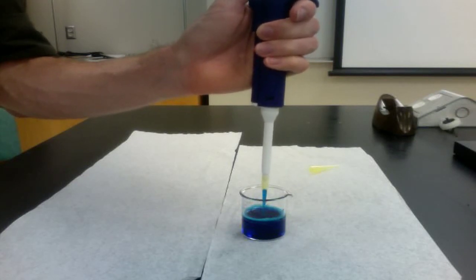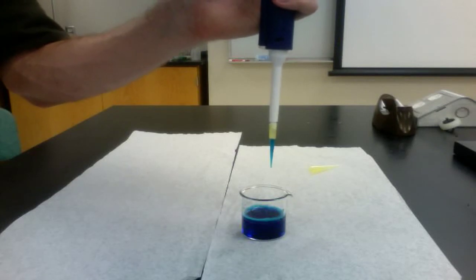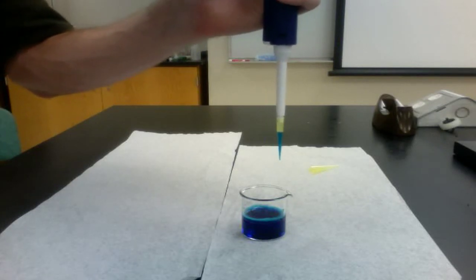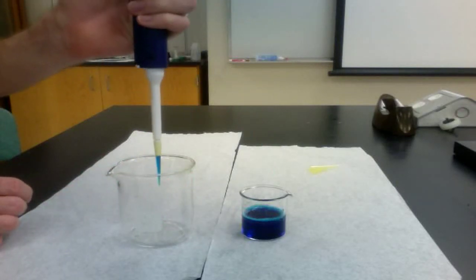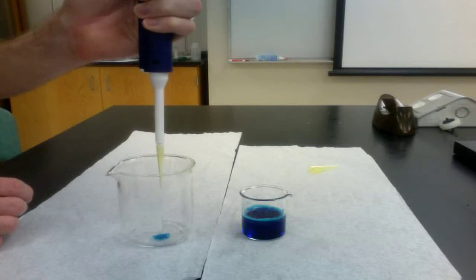Always hold the micropipette straight up and down. Do not tilt it sideways when aspirating solution. In addition, do not immerse the tip more than a couple of millimeters into the solution. Immersing the tip too deeply will change the volume drawn into and delivered by the micropipette.